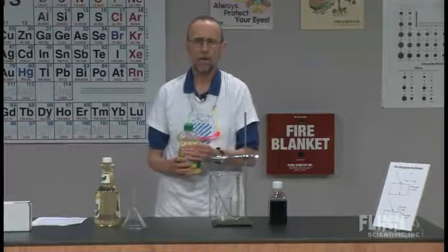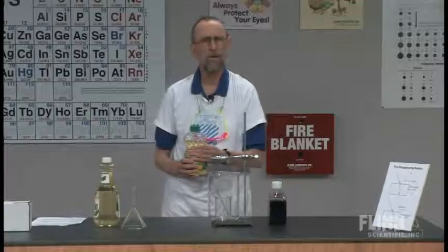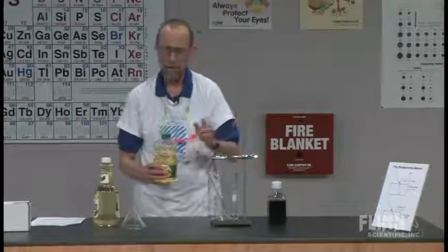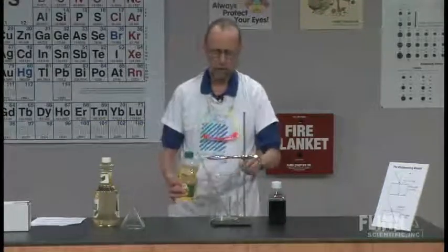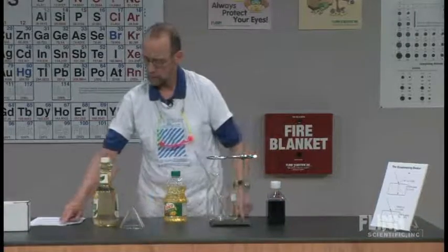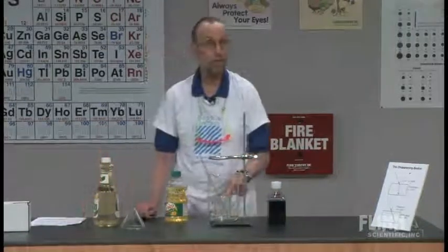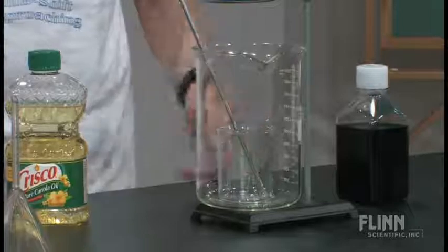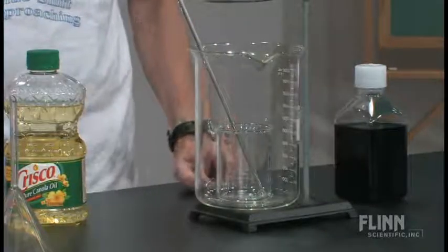This one happens to be called the - I'm not going to give you the title, because that will give away what we're doing. You don't want to do that in a demo. So here, Dave, this is from my script. Dave, we have a small beaker inside of a large beaker, and this is a stirring rod, all glass.